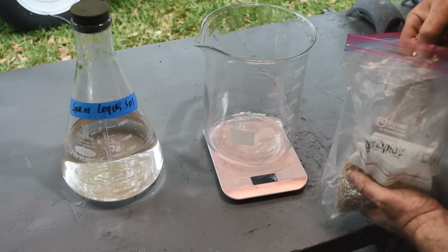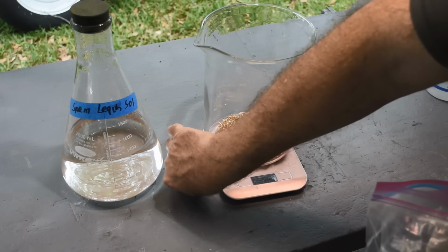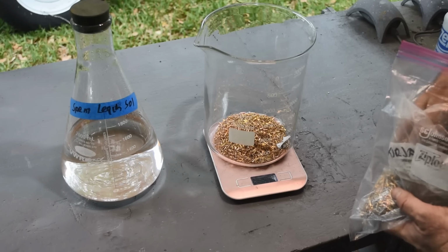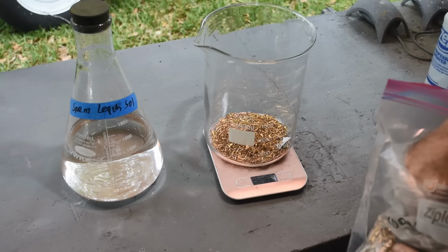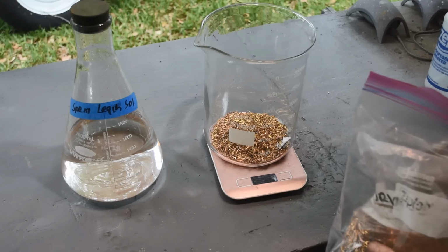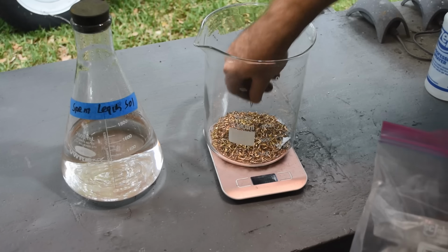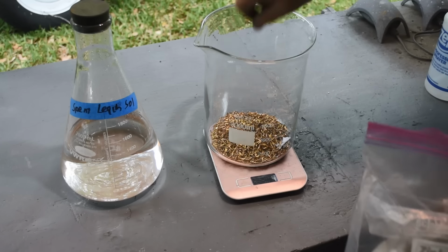First off, Owltech, thank you for sending me your new recipe. I appreciate that. I haven't had a chance to try it yet. I will probably try that in a future video. But I have a whole bunch of mixed up leach already that's spent, and I know I can regenerate it. So we're going to regenerate it and try it on these pins. 301, close enough.